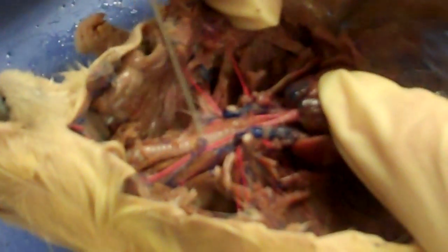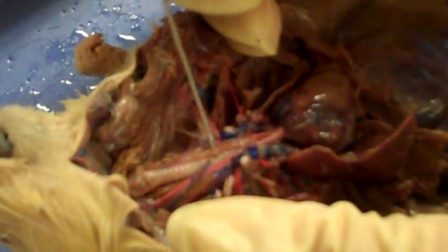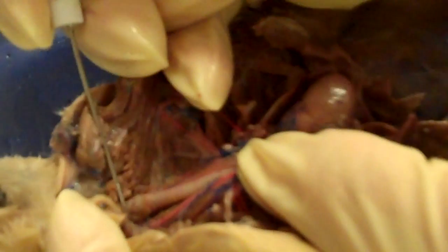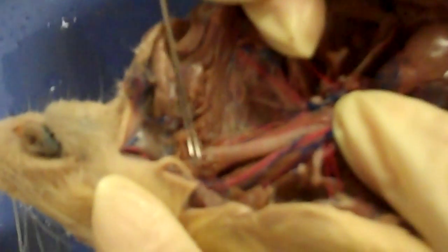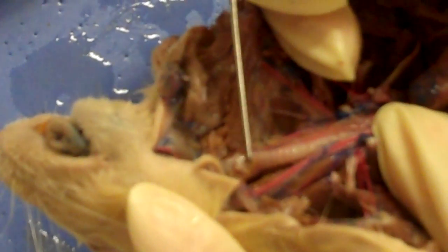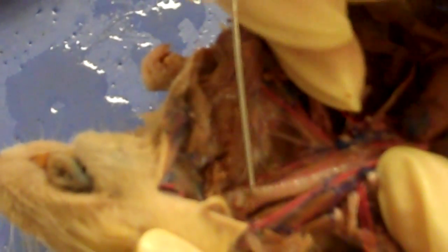This would be your trachea. At the top of the trachea you find the larynx. And the thyroid gland is a strip of tissue just below the larynx — not too pronounced in this one though.